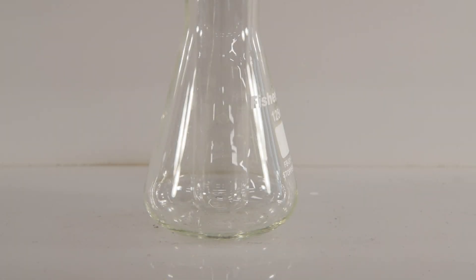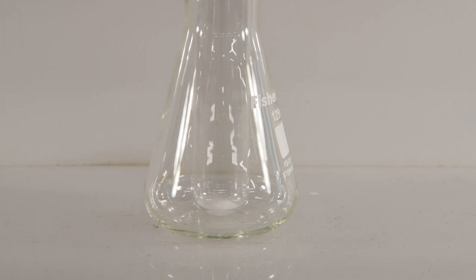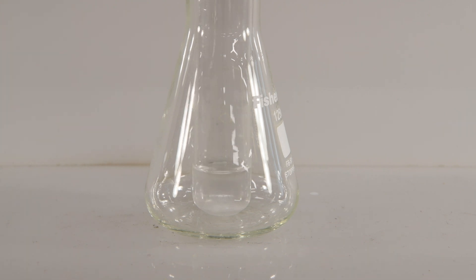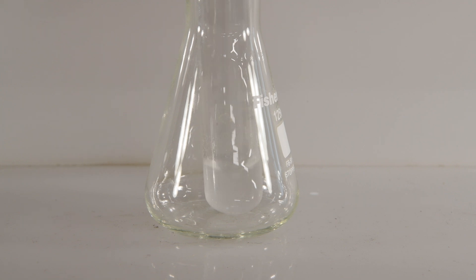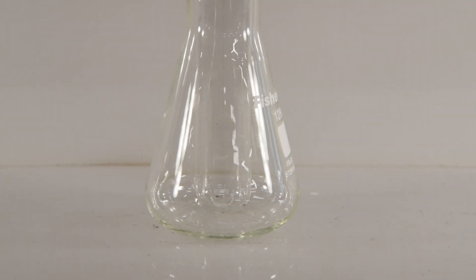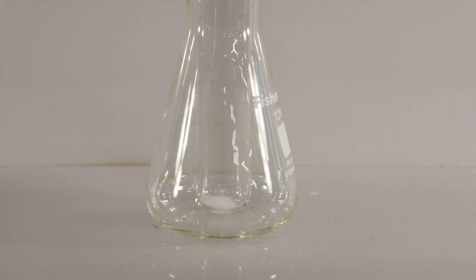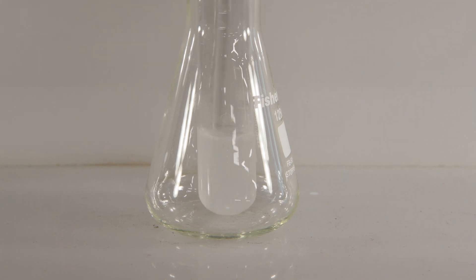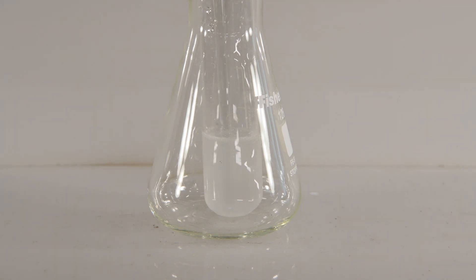And finally, let's test the solubility of our silica gel — ground up sand. We'll put some silica gel in a test tube and add some ethanol, give that a stir. It's pretty obvious that the silica gel is not dissolving in the alcohol. And last, let's test the solubility of silica gel in water. We'll give that a stir — and it's pretty clear that it's not clear. You're probably not terribly surprised that sand doesn't dissolve in water, or there wouldn't be a lot of beaches out there.